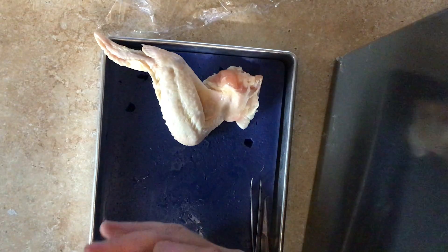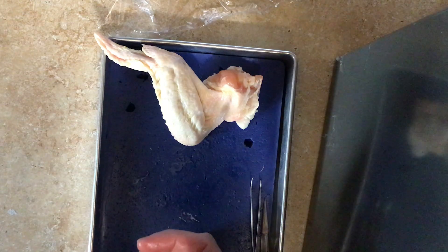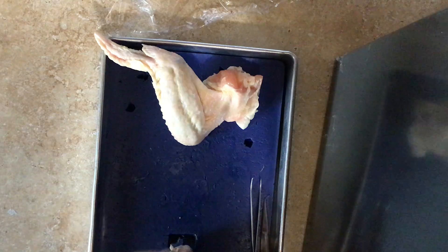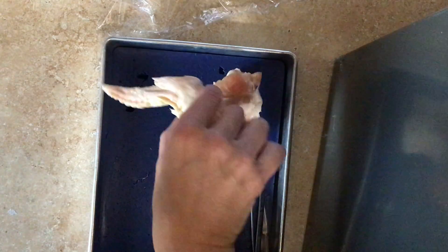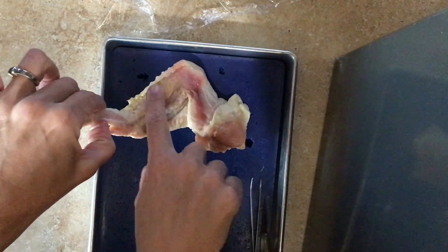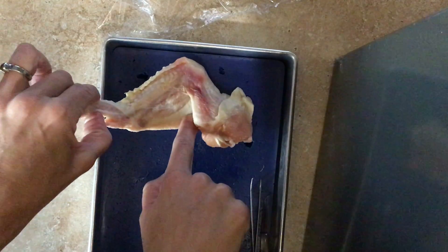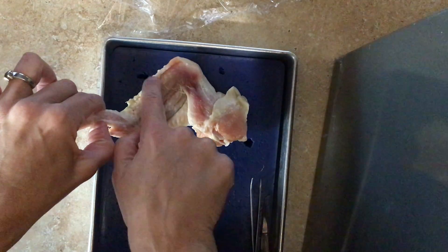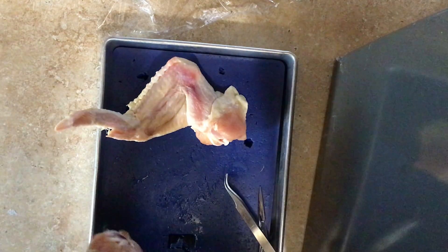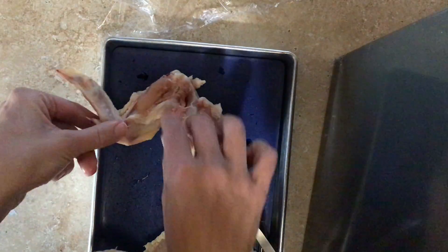As I go through how we dissect these, there's a chart on that worksheet, and that's the kind of stuff you want to talk about. If you're dissecting this chicken, here's the upper portion of the wing. We actually flipped this over to the under portion of the wing where you can see through the skin a little bit better. I have a dissected chicken wing here — we made a cut along here and then peeled that down to eventually expose muscle.